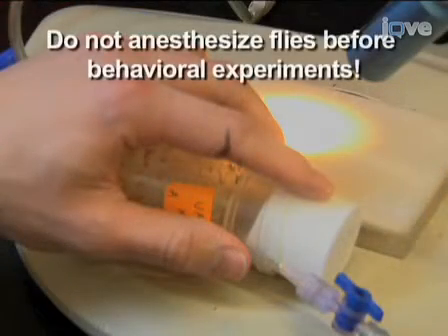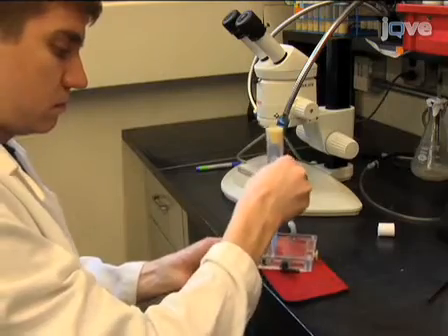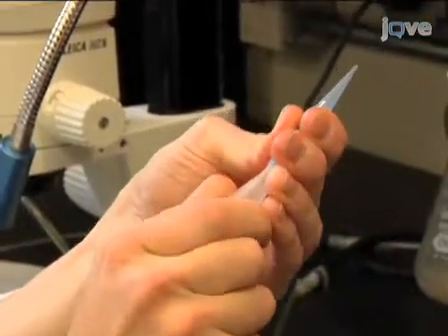Anesthetizing the flies immediately before conducting a behavioral assay can potentially compromise performance. To avoid anesthesia, use a funnel with a small outlet to gently knock flies into the chamber. To make a funnel with a small outlet, attach a P1000 blue pipette tip to the end of the funnel.